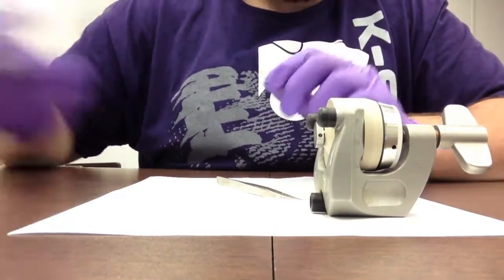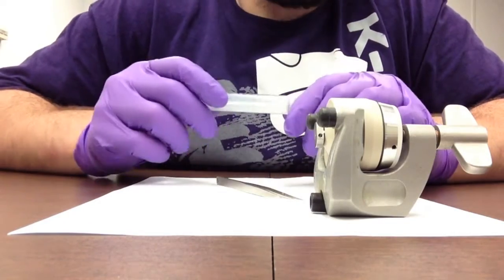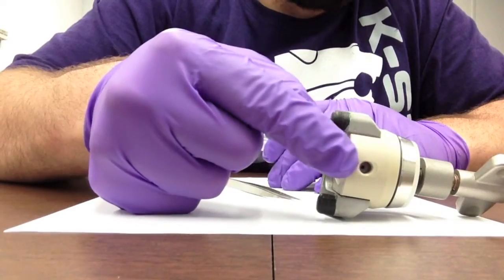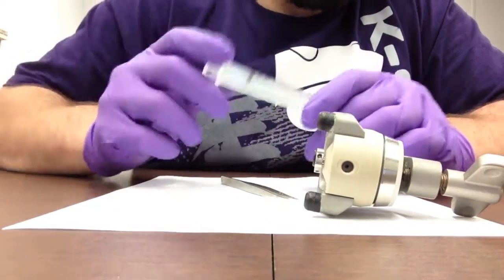We need a third electrode for our reference electrode, and thus this design allows us to actually insert a small piece of lithium into where our injected electrolyte is.